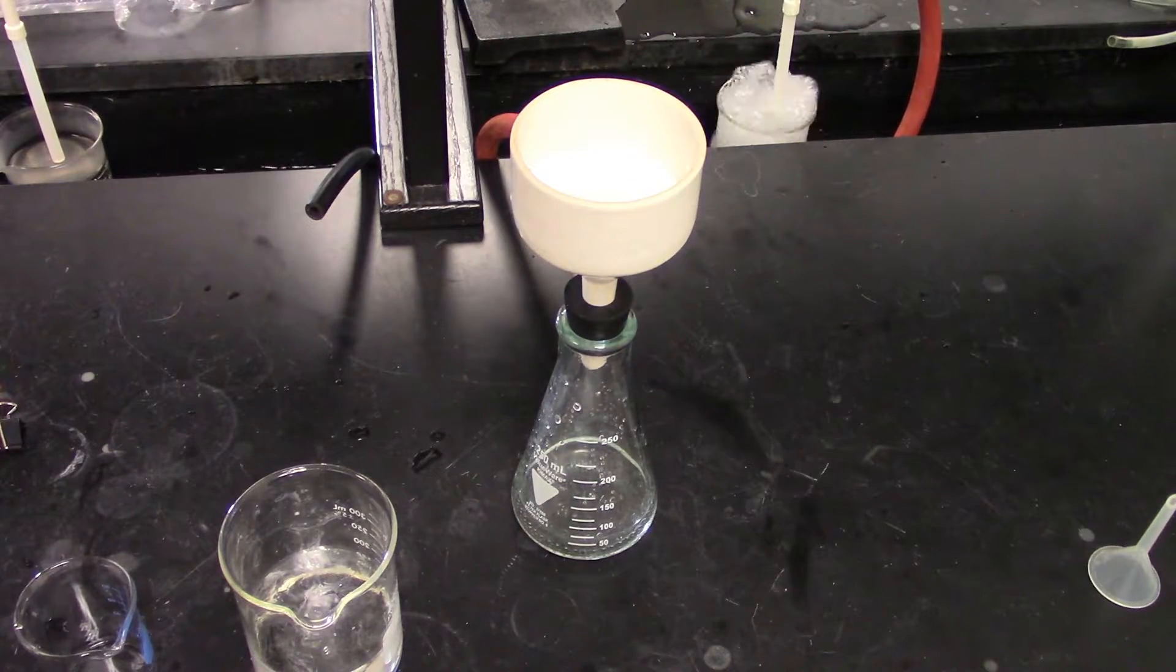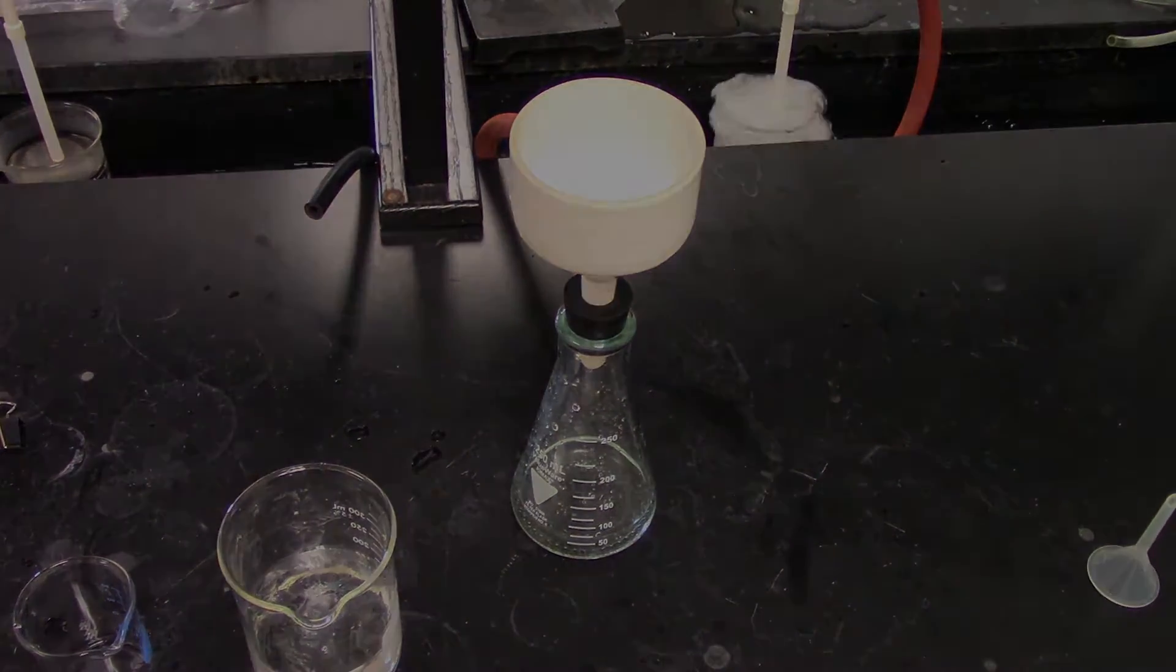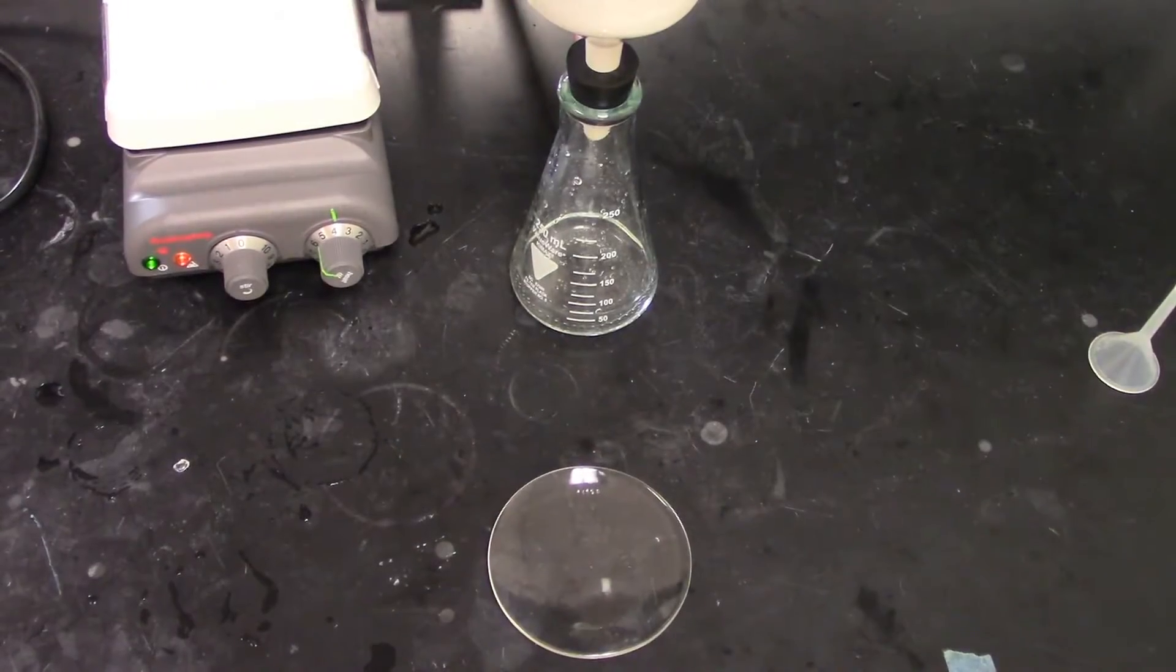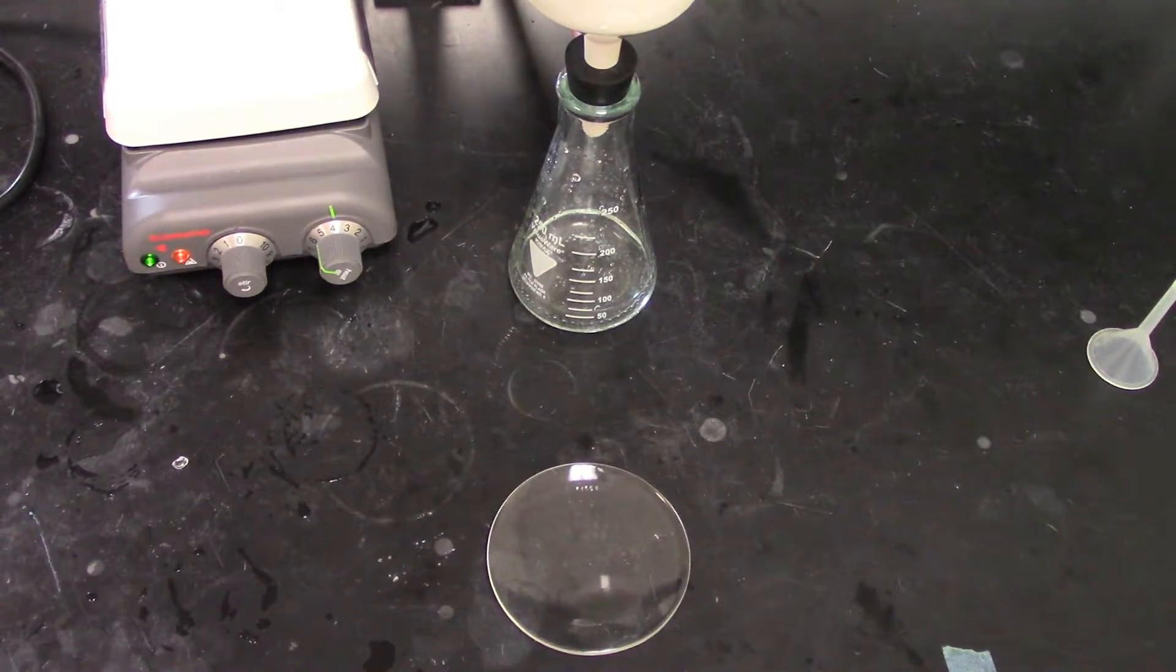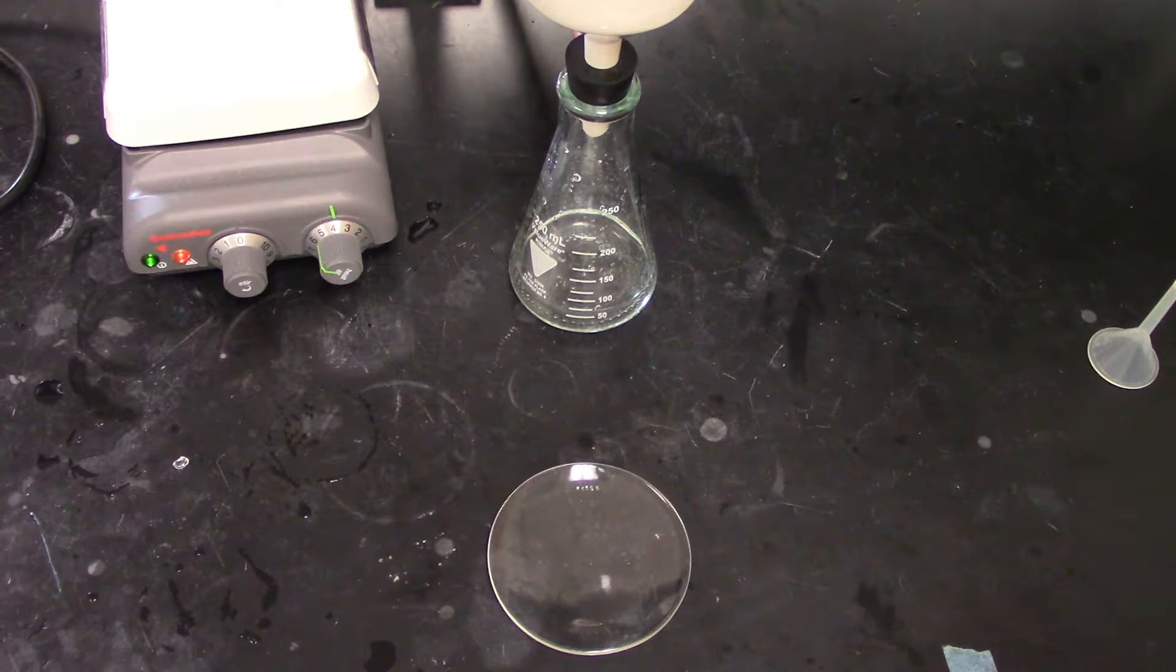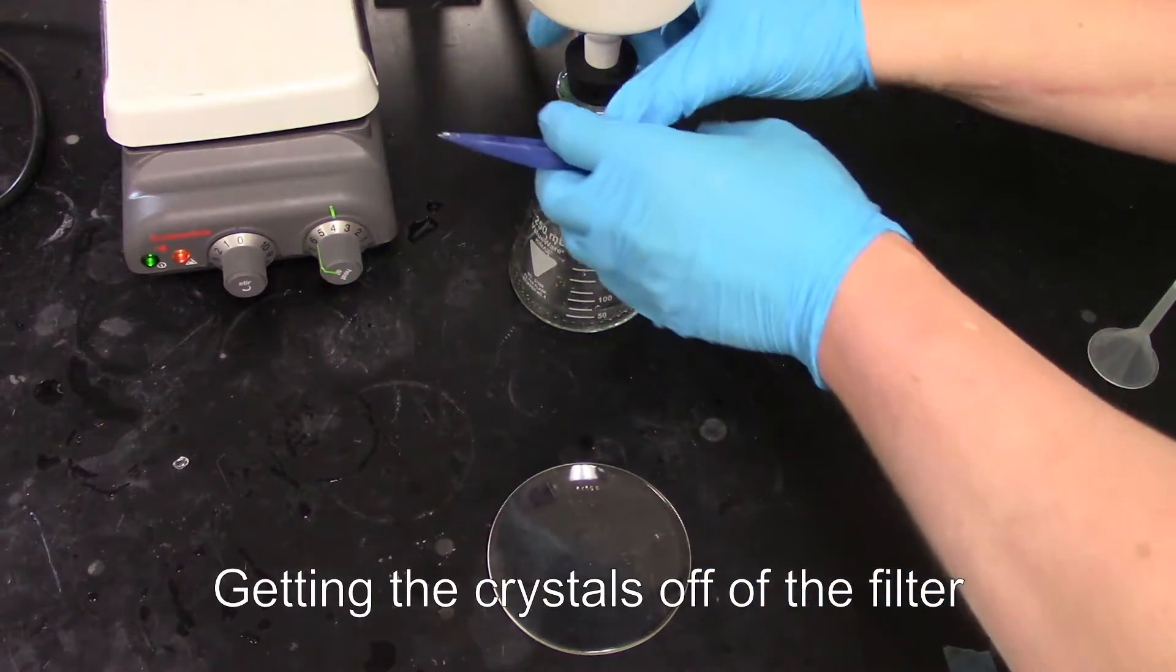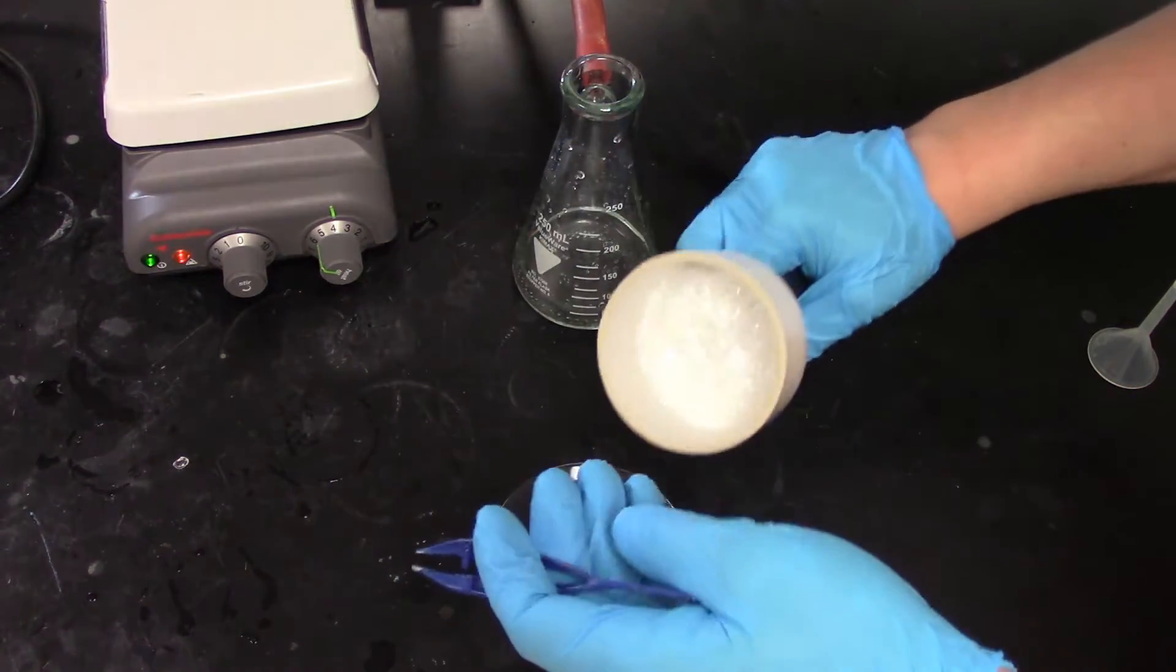I'm going to cut the video off now and give it a little bit of time to dry out and we'll weigh it on the scale. I get a lot of students to ask me what's the best way to get the filter paper out, particularly in a situation like this where we got a lot of crystals. What I really recommend for this is put it onto a pre-weighed watch glass. We're going to use this watch glass to weigh the material.